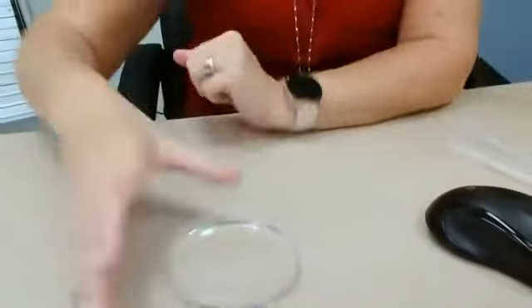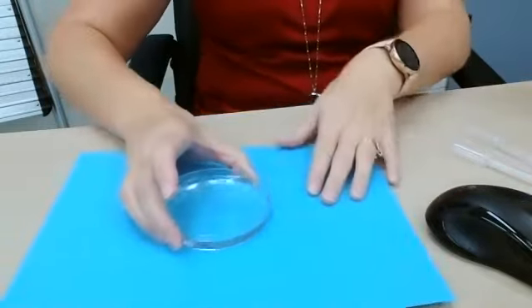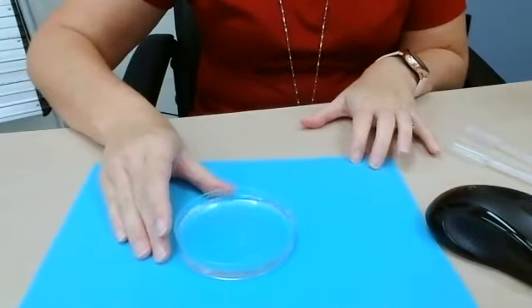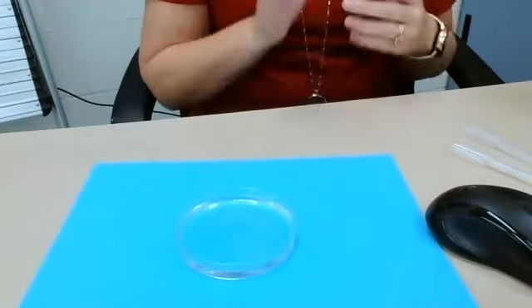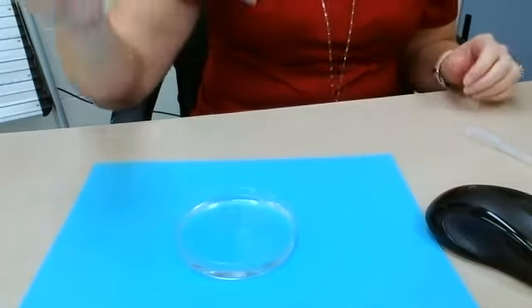Now we're going to go on to the last page called sheen. It says take a clean beaker of water and predict what will happen if you add one small drop of oil using a medicine dropper. We're going to improvise with a petri dish — it works just the same. I'm going to put a little bit of water in here, put it on my desk, and add a paper underneath so it's easier to see. I'm going to take a dropper and add one small drop of oil.